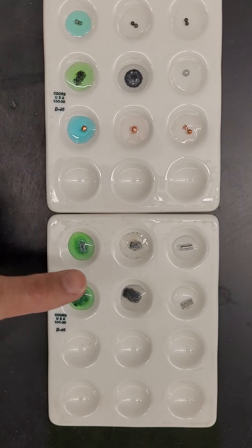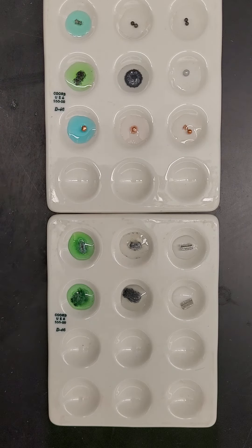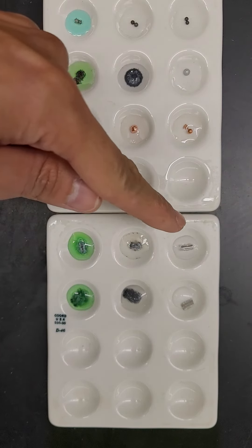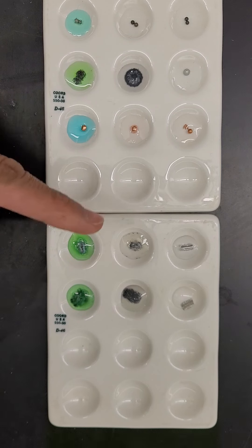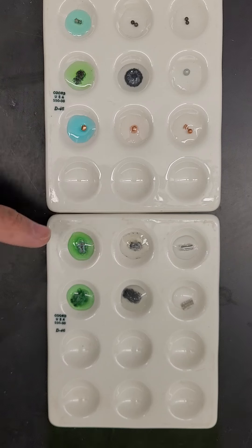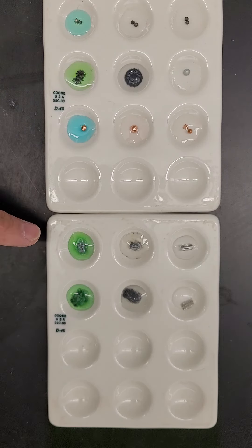The fourth column has the aluminum pieces. The very first row with zinc nitrate doesn't look like anything changed. There are definitely some changes in the second row — there are bubbles, the aluminum had broken up into smaller pieces. Similarly with copper nitrate, we can definitely distinguish that change.